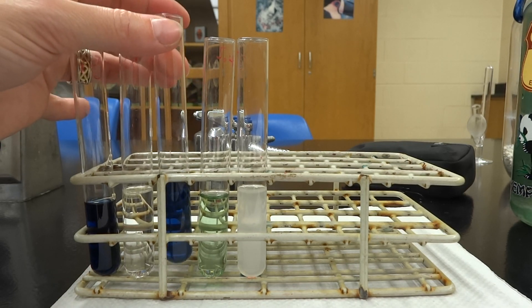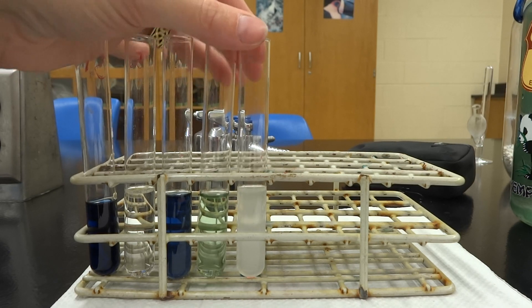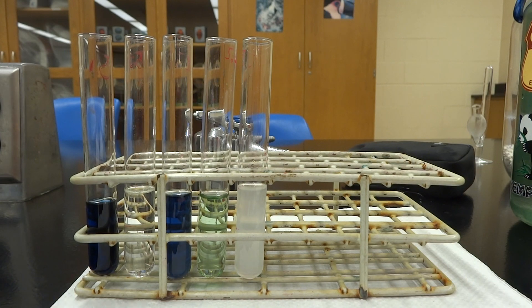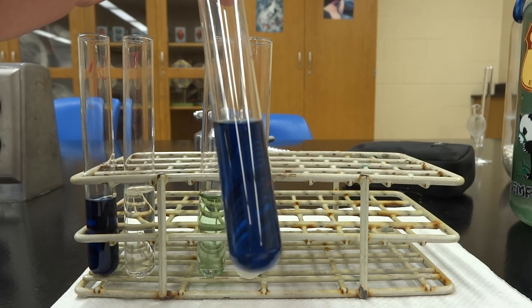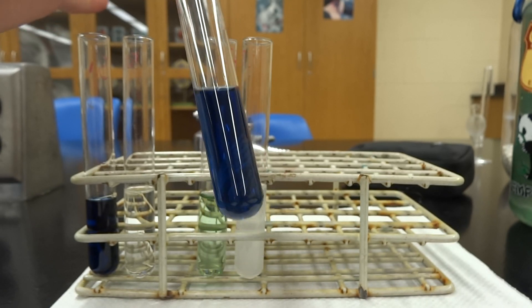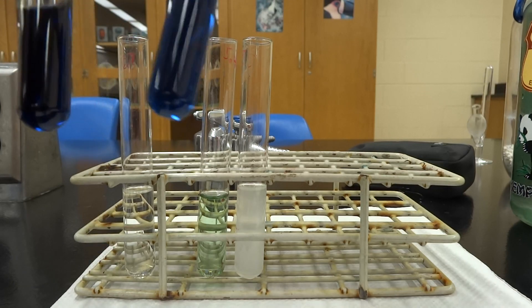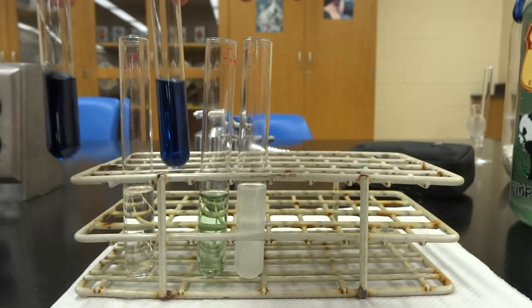Numbers three, four, and five are our unknowns — we don't know if they're going to test positive for DNA. Number three is half DNA and half water, so it does turn blue, but it's a lighter color than our positive control because it's diluted — it's about half of what the positive control is.